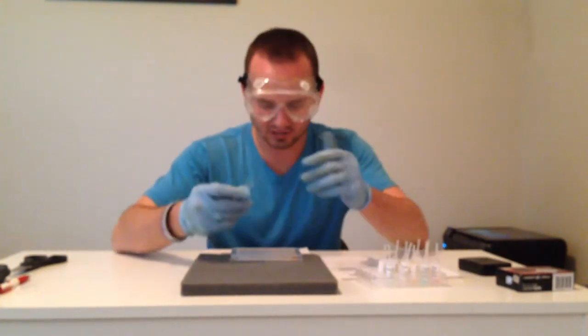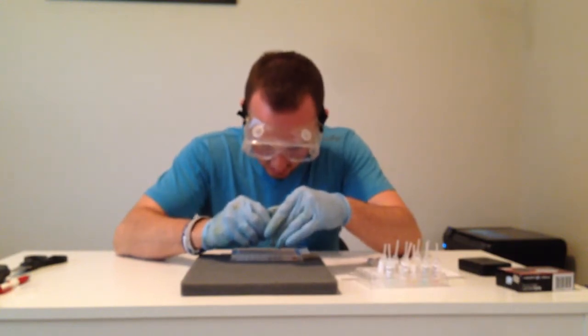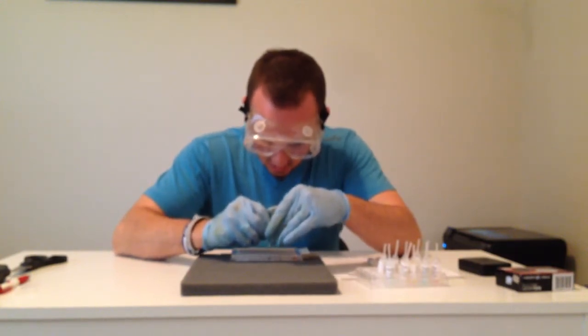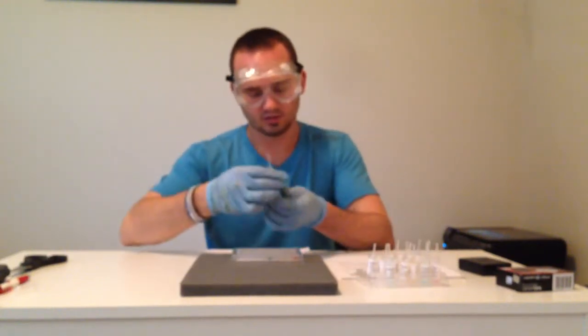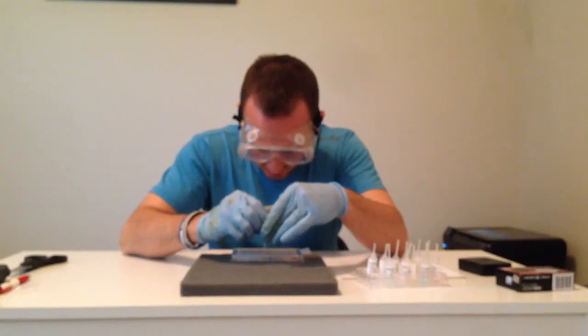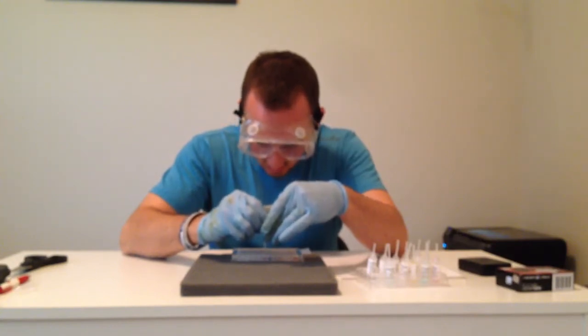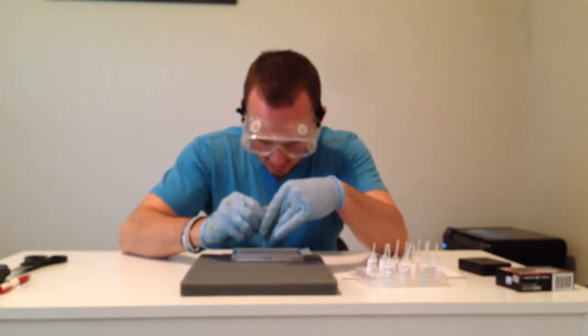This is sodium hydroxide. Same thing, 2 drops in each one of these rows. And put it to the side. And then our very last one is sodium phosphate. Same procedure. As I said, I have already gotten the first half of the lab all the way done. And 2 rows.